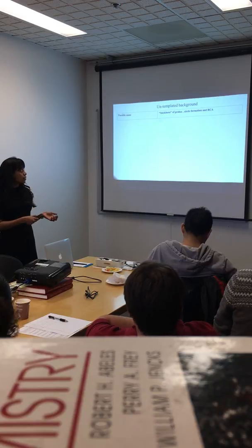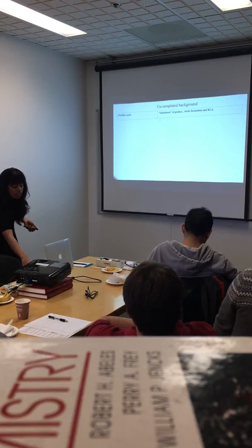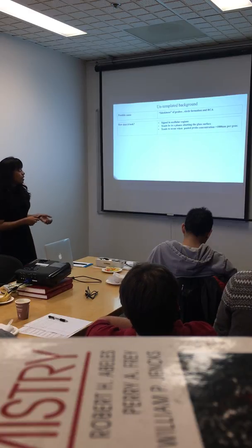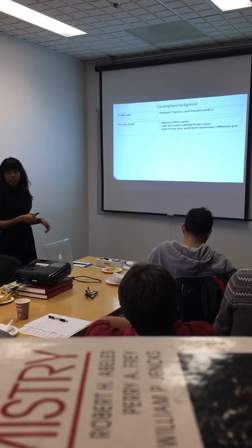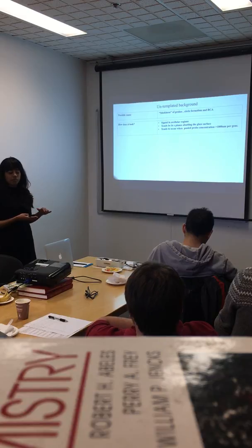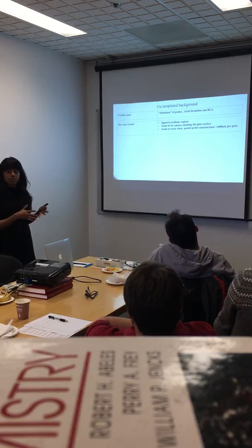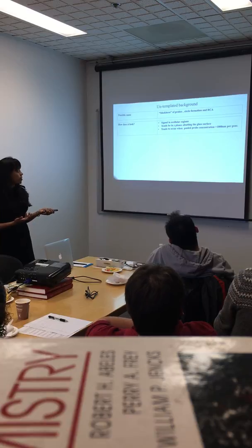So that's one reason why you might have a high concentration of probes sticking onto surfaces, clumping, and they might initiate circle formation, RCA, and you might end up seeing something that looks like puncta. You mostly see it distributed in acellular regions, regions which have no nuclei, no DAPI signal, but still show bright puncta. When you image your sample in a confocal microscope and scan through the different Z-planes, you will see that the puncta from untemplated background are usually closer to the glass surface, which is where the probes clump and result in rolling circle amplification.